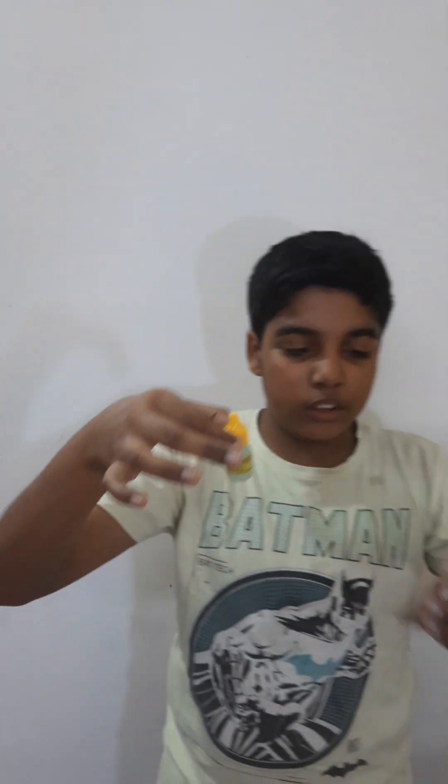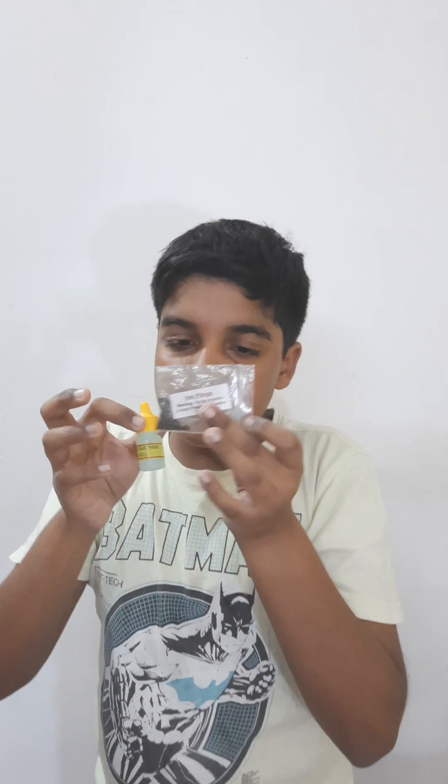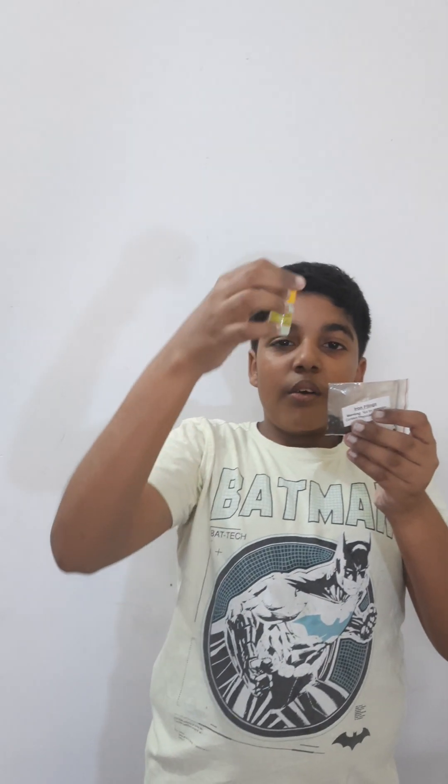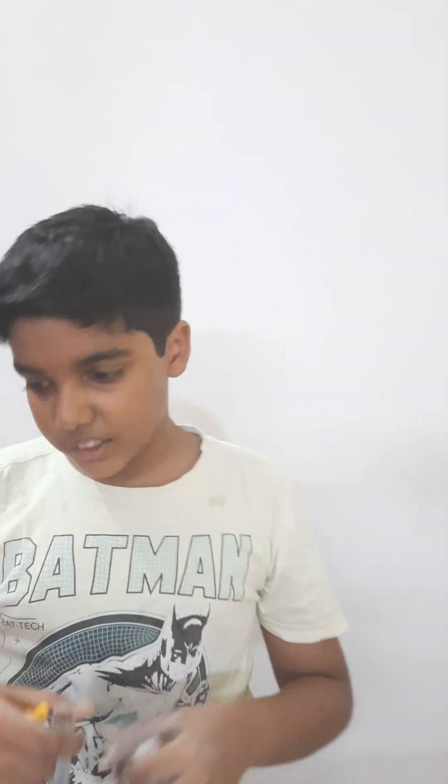We have our copper sulfate ready, and we also have these iron filings, which are important — you cannot use an iron nail as it can damage our test tubes. So we have iron filings here and copper sulfate here. We're going to mix them in a test tube and see how they react. We'll keep it inside a test tube and observe the results.